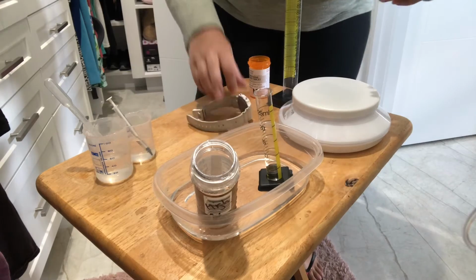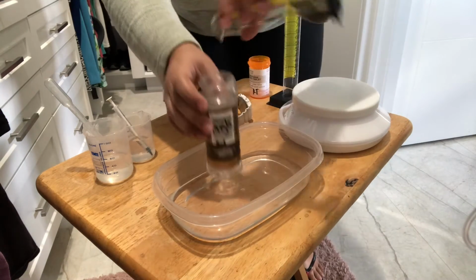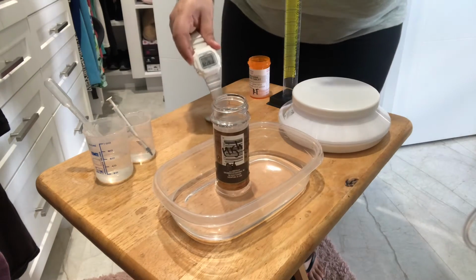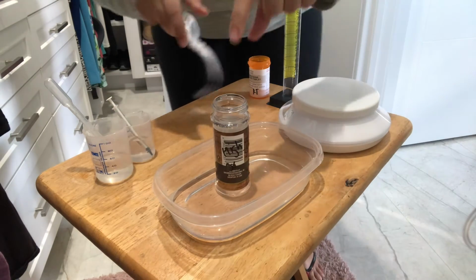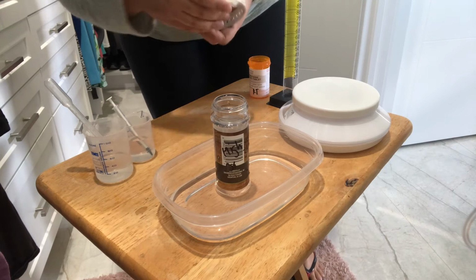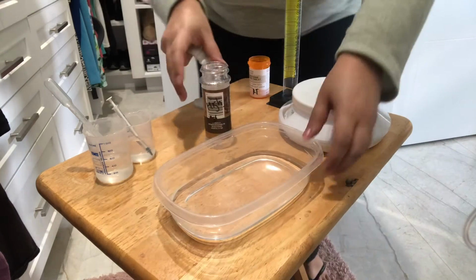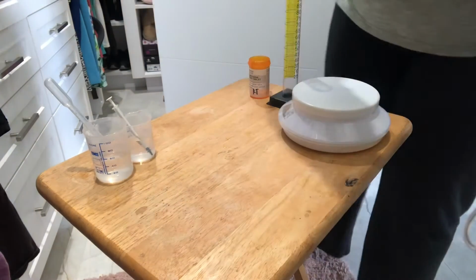And immediately after we take it out, we're going to pour our hydrochloric acid into our sodium thiosulfate, press the timer, and stop the timer once we see our yellow sulfur precipitate form. And then that concludes the hot bath. We can move that out of the way.